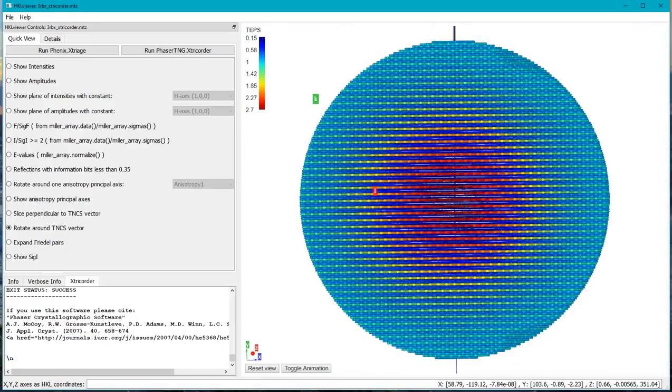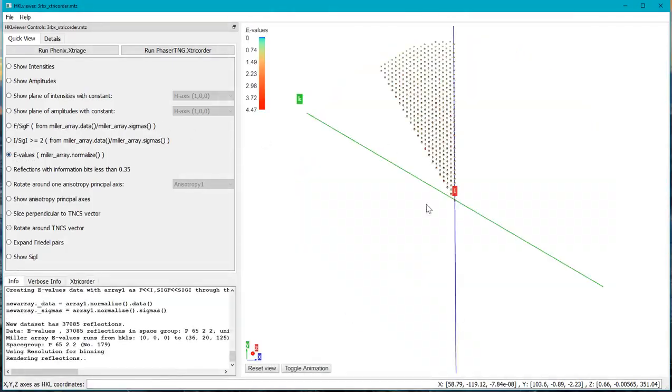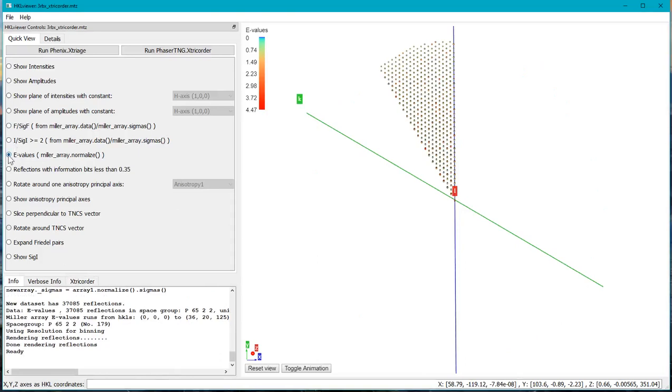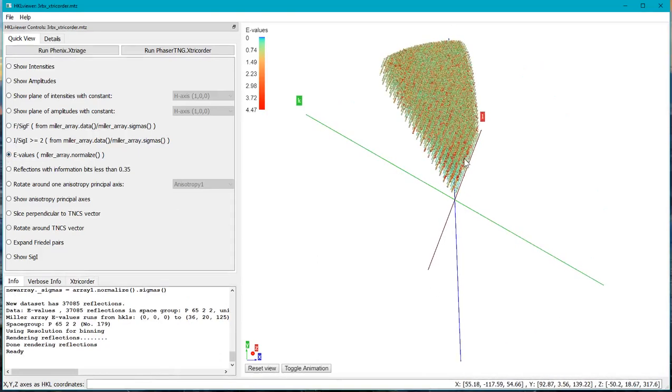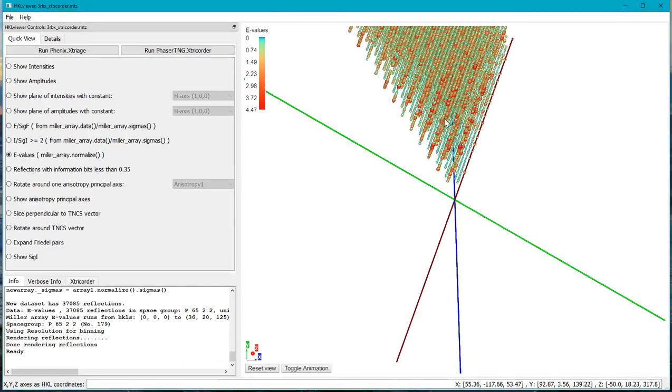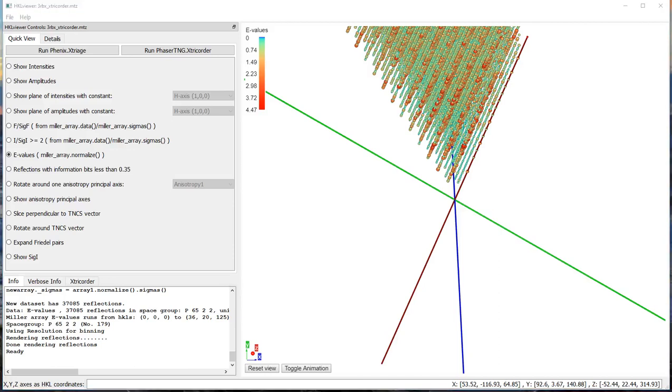So if we were to compute e-values based on this data, we would get something looking like this. So we just press the e-values button here in the Quick View tab, and we can see for the e-values, even there's quite strong modulation here. So this data here would be no good unless we apply the TNCS correction terms. Now, correcting the data is all done internally by Phaser, but let's try and manually do the TNCS correction here.